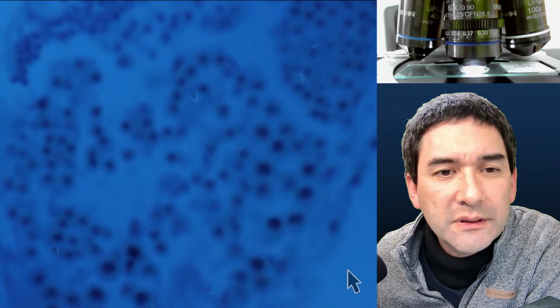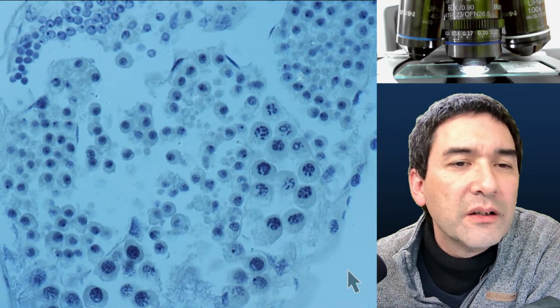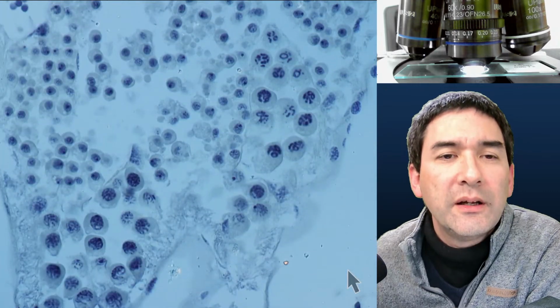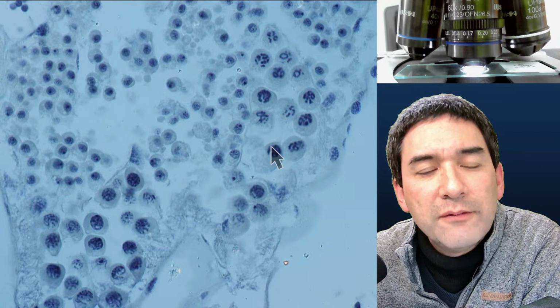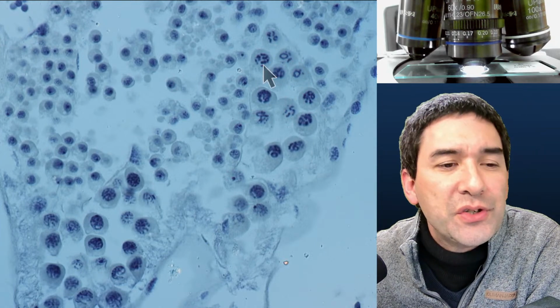Let's go to 60 times. I don't know. This would be actually quite interesting again. This is clearly a stained sample. Let's make it a little bit brighter here. And I need to focus. This looks, yeah, this is most likely. That's maybe the reason why they included those. What I would guess is that those things, that's the nucleus definitely, and those little structures in there could be chromosomes.